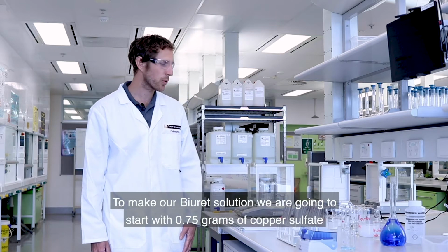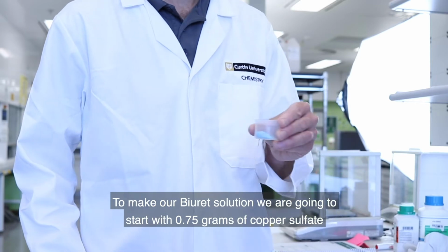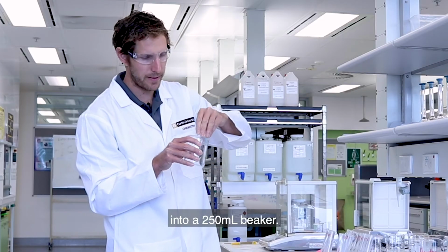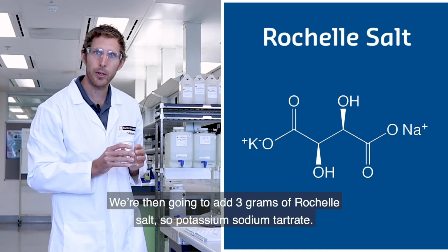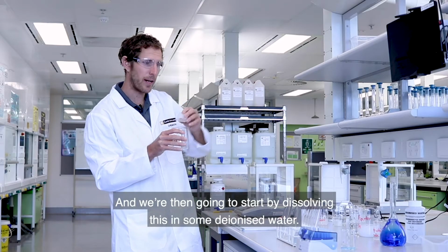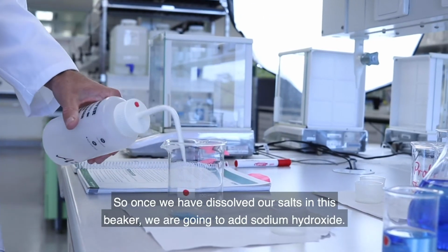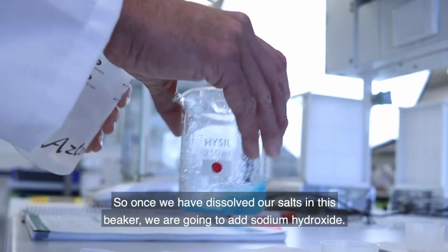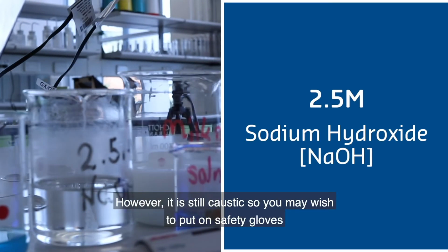To make our biuret solution, we're going to start with 0.75 grams of copper sulfate into a 250 ml beaker. We're then going to add 3 grams of Rochelle salt, so potassium sodium tartrate, and we're then going to start by dissolving this in some deionized water. Once we have dissolved our salts in this beaker, we're going to add sodium hydroxide. We're using relatively dilute sodium hydroxide, 2.5 molar.